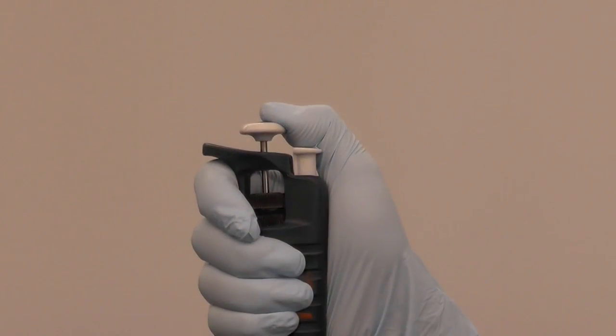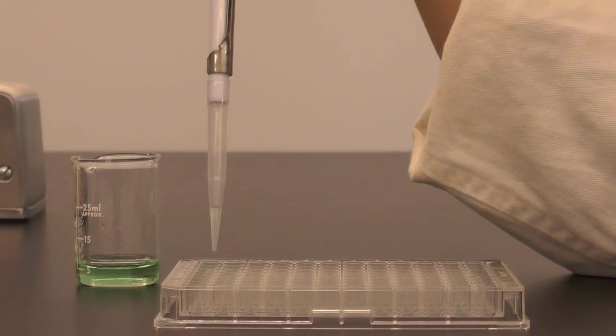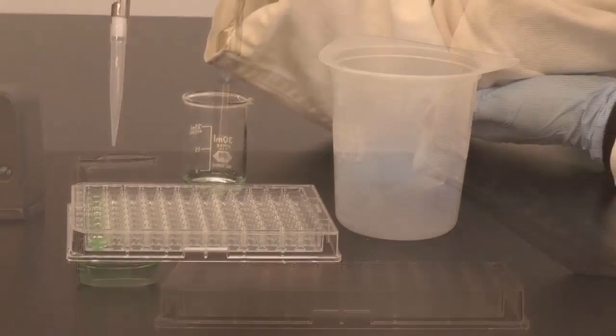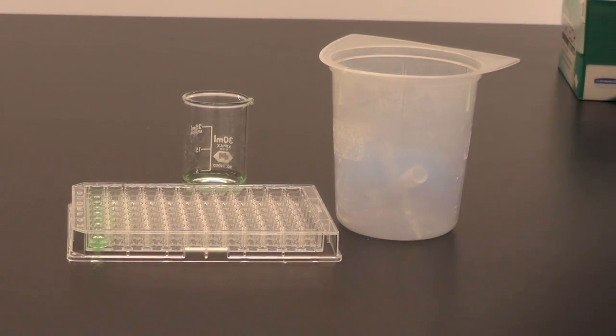Now dispense your liquid until the first stop. Leave the remaining liquid in the tip to repeat the process or discard the remaining liquid along with the tip into the garbage bin.